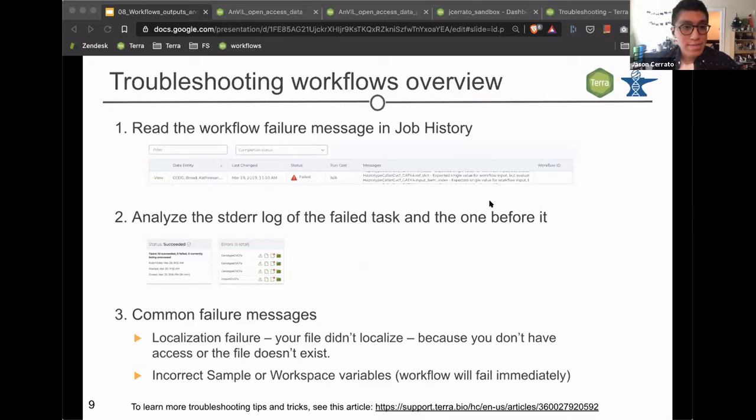why it failed. So one thing you can do, once you click into one of those submissions on the job history page, and I will go over this with an example in a second, is view basic information about what kinds of errors the Google machine ran into. You can go further down and look at the log for the run that you did, or the standard error file, which should provide you some information about what went wrong there.